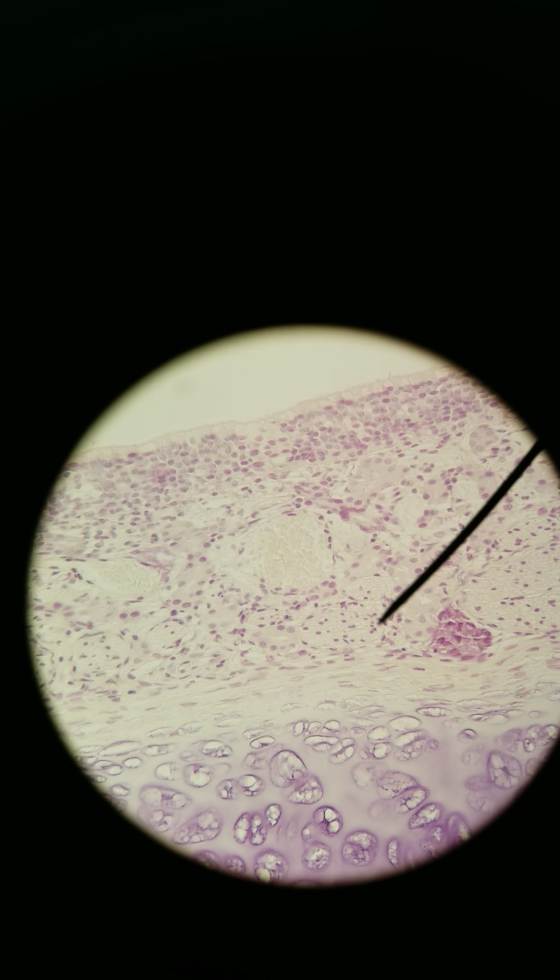So these are the bundles of axons of the sensory neurons coming from over here. So once again, olfactory sensory neurons for smell have their dendrites, called cilia because they're hair-like, exposed to the apical side. This is a mucous membrane. When you smell things, chemicals, molecules dissolve into that mucus, bind onto those dendrites and activate the sensory neuron.